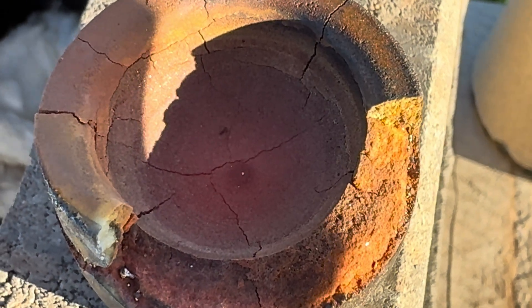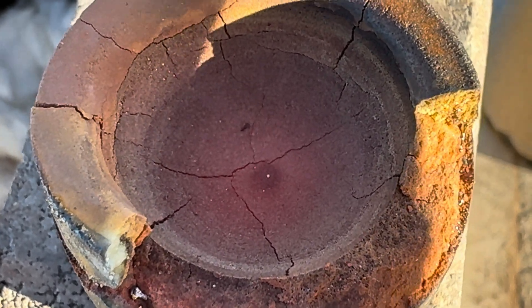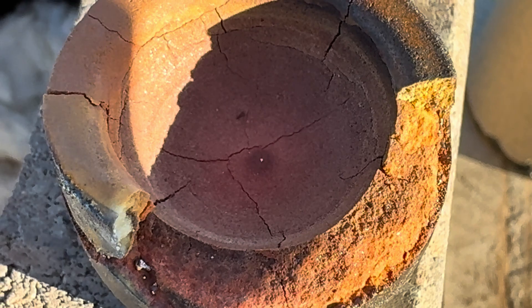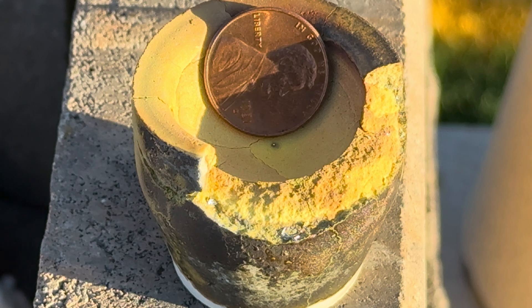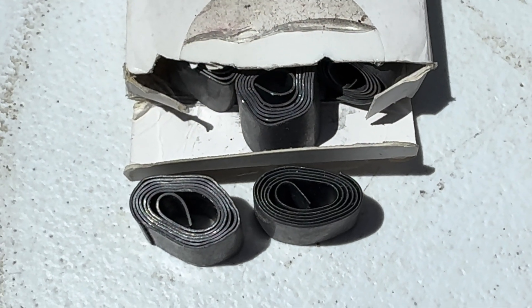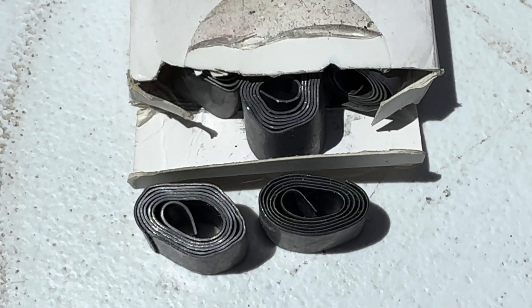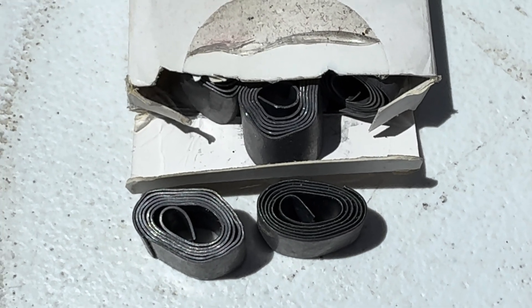You can see our tiny silver bead that we got from 100 grams of high litharge with flour. Here is our silver bead measured up against a penny. I do want to mention that you can use lead instead of litharge as a metal collector to extract the precious metals from your smelt.